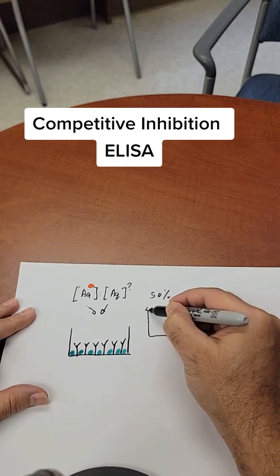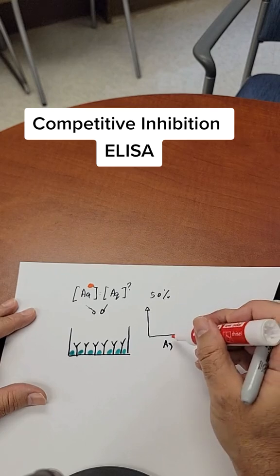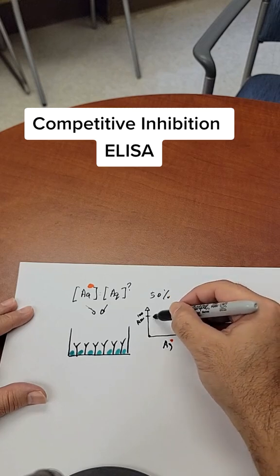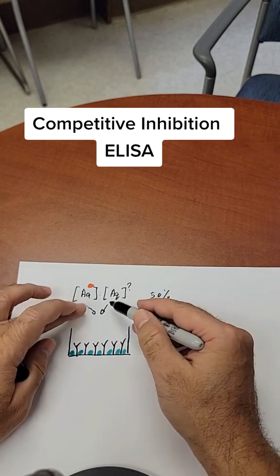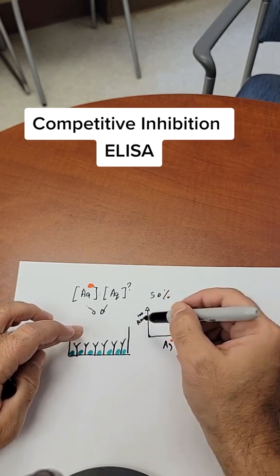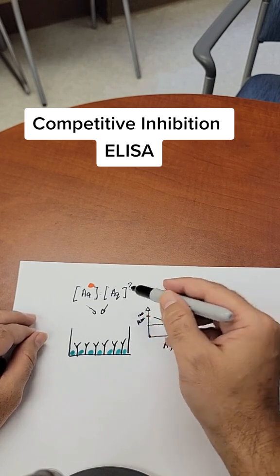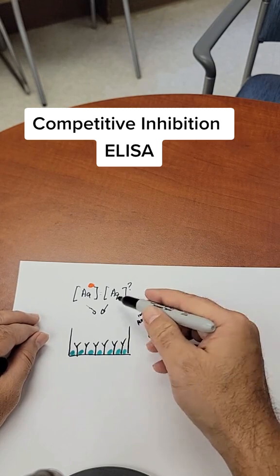The standardized curve is built using the non-labeled antigen — you dilute it out starting from zero dilution, at which we have 100% relative light units, and dilute it out until you have nothing. Ideally the curve is a linear downward curve. When you mix both, you can estimate the percentage inhibition by measuring the RLU and plot the estimated concentration of the unlabeled antigen. For example, if the two are equal, you'll have 50% inhibition and you know exactly what the concentration of the analyte is.